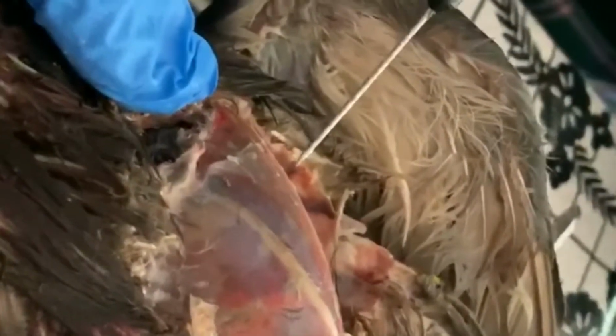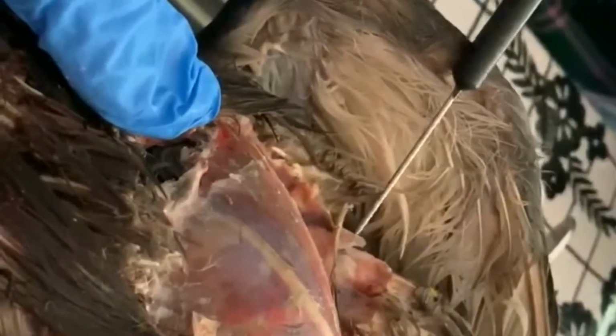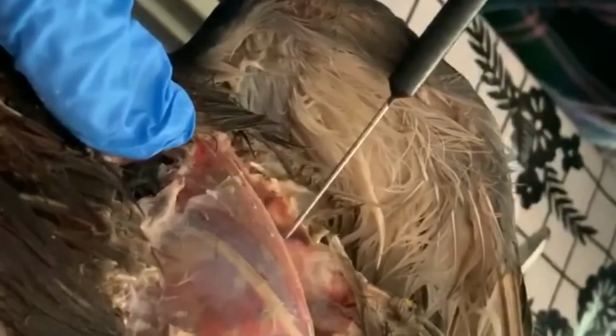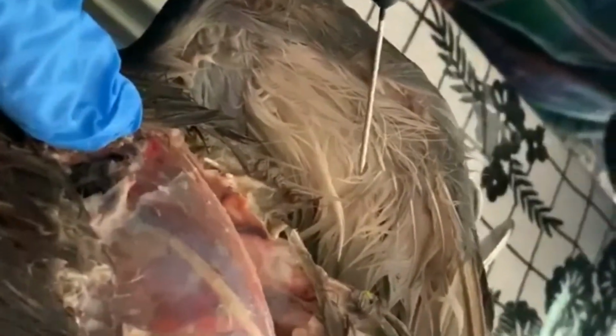So if you've ever watched Dwayne "The Rock" Johnson, there was some movie, I think it was Journey to the Center of the Earth or something like that, where someone threw a berry at him and he used his pecs to pop that berry right off and bounce back, right? Pecs are your chest muscles. These are what attach to your sternum or your breastbone.